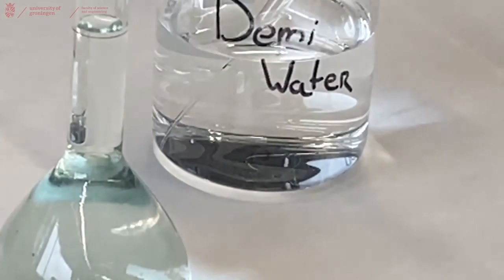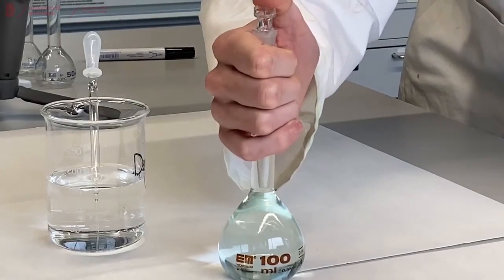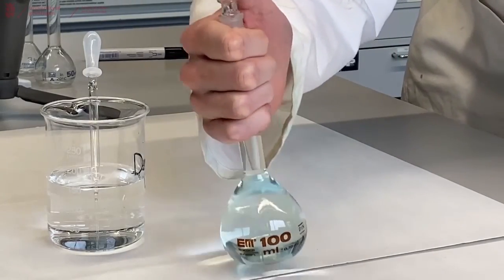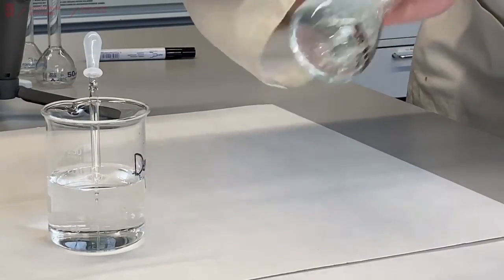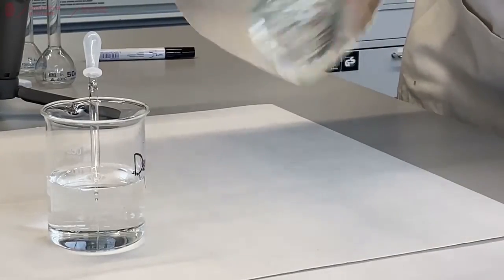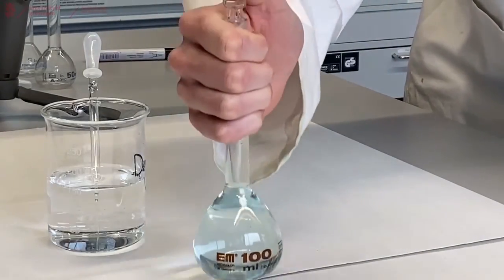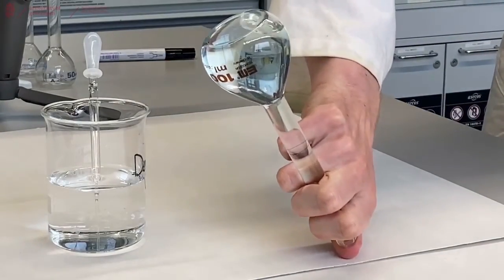Now the only thing that remains is capping and vigorously shaking to make sure that it's properly dispersed throughout the whole solution. And not spilling anything. That also works holding it upside down.